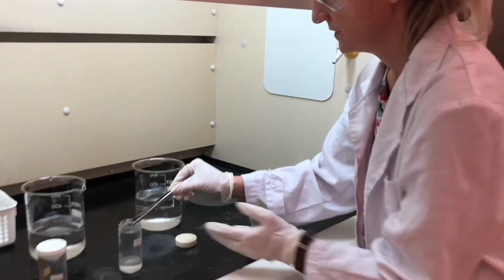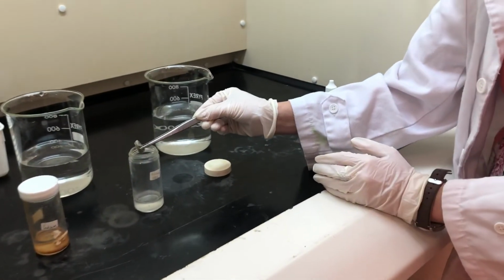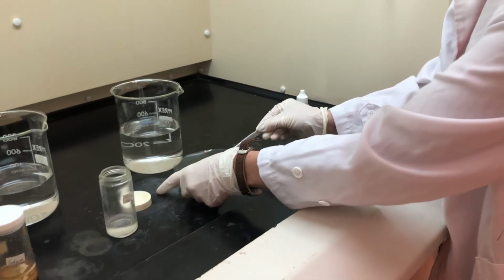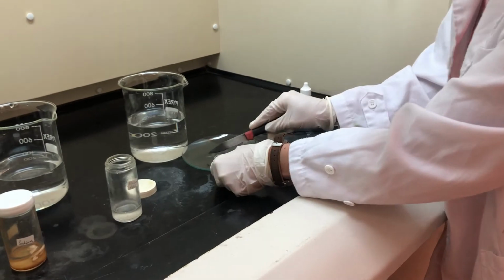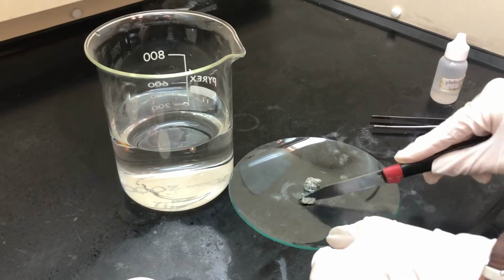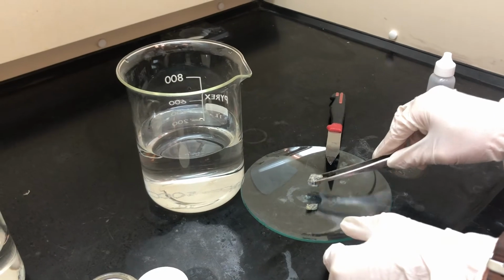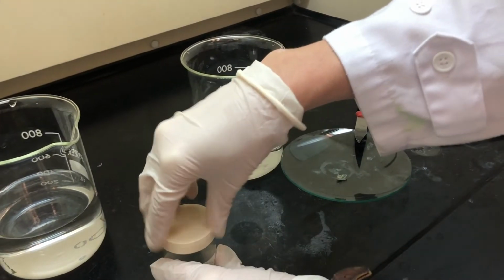and you can see that it is a soft greyish metal. I'm not going to use that whole piece, I'm just going to use a little bit. And the really cool and interesting thing about it is that you can cut it with a knife because it's soft, okay? So I'm just going to use a very small amount. We've stuck the fume hood on because we don't want to breathe in those fumes. The rest of it I'm going to pop back in. I'm going to put the lid back on.